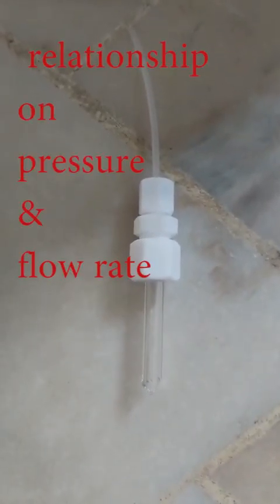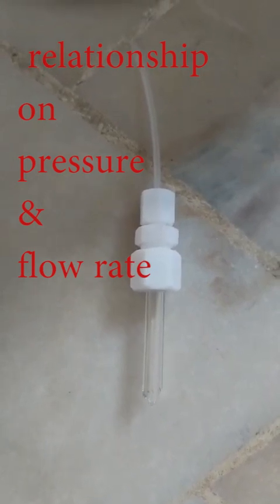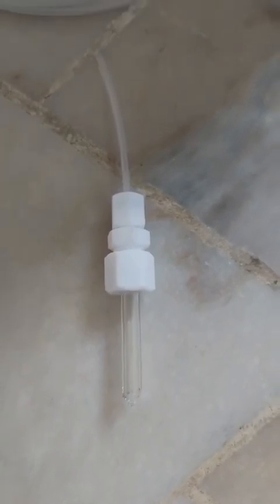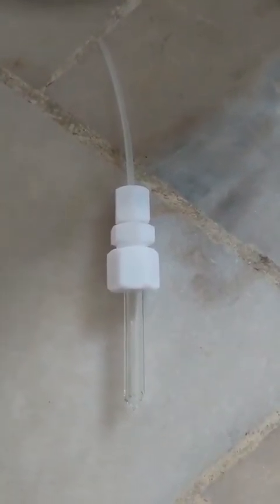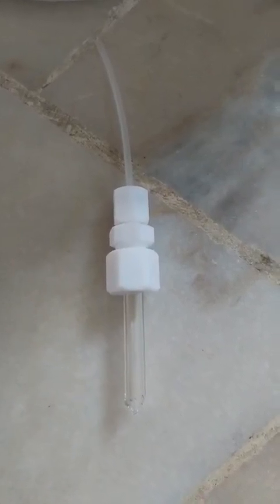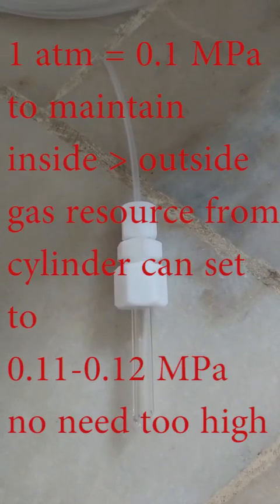In gas flow control, we have two different types of control. First, you control your device by pressure, and the other, you control your device by flow rate. In our case, you are applying gas flow control under atmosphere and controlled by the flow.